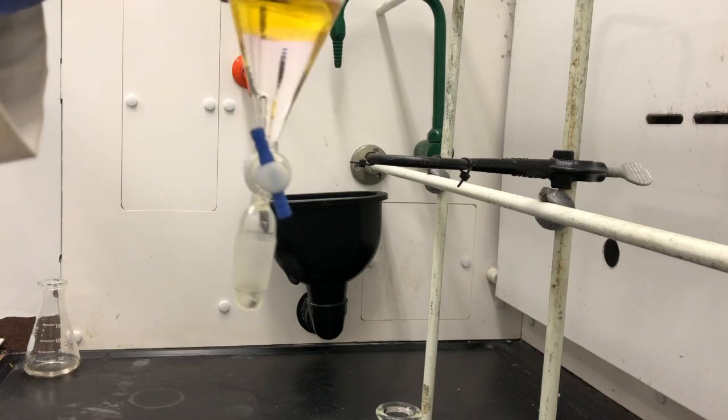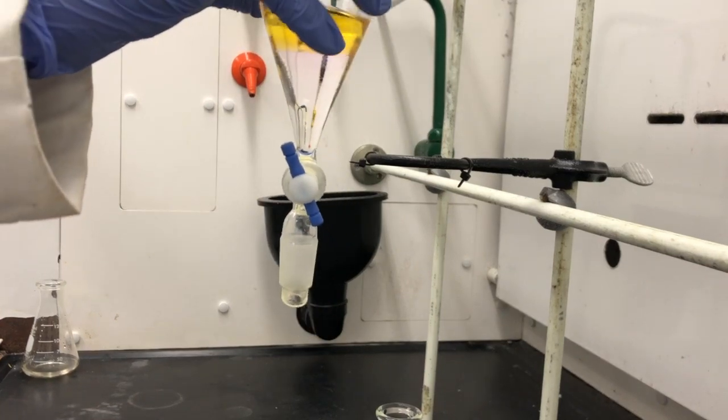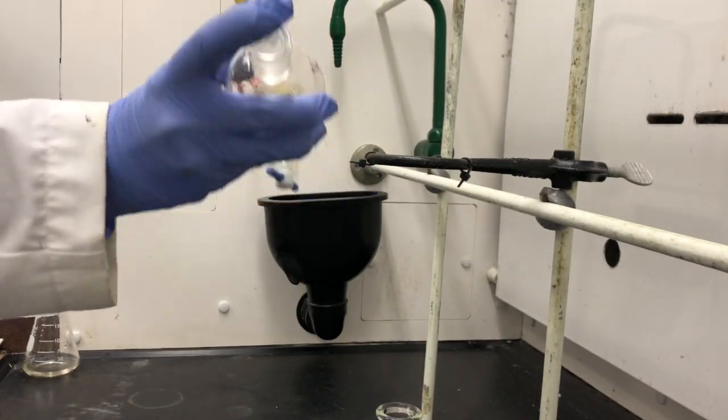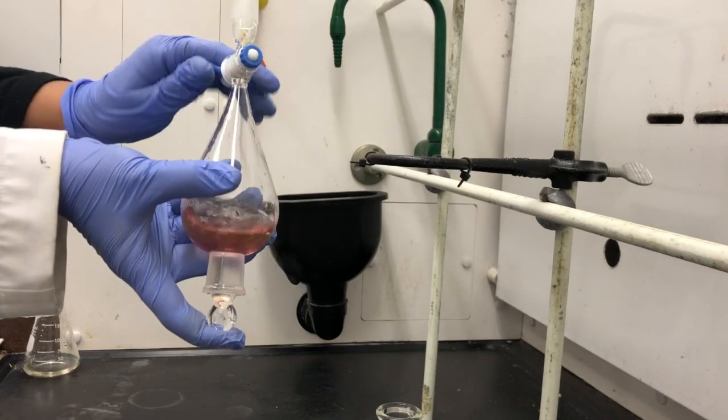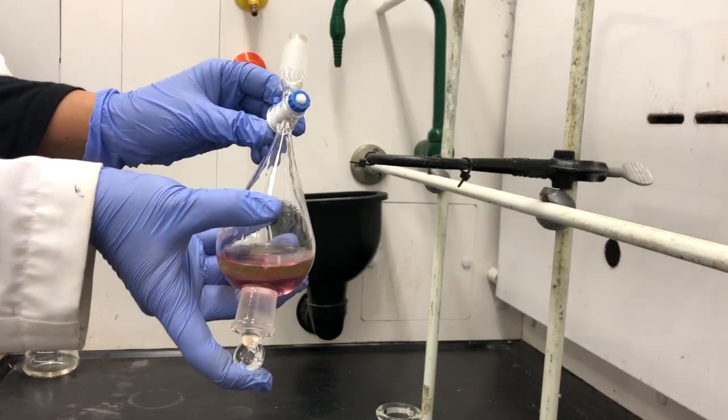And you can already see the different layers developing. We're going to make sure our stopper is on, we're going to mix, and then we're going to vent it. And you may have heard the gas.